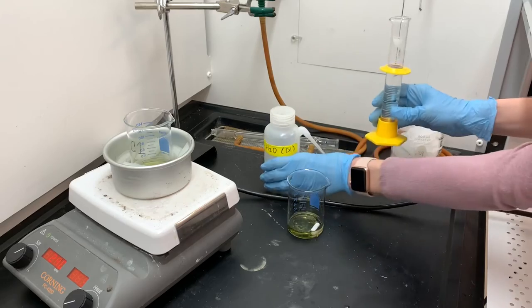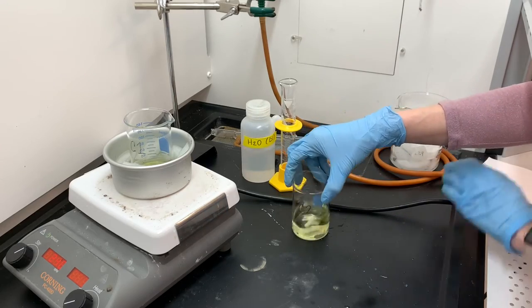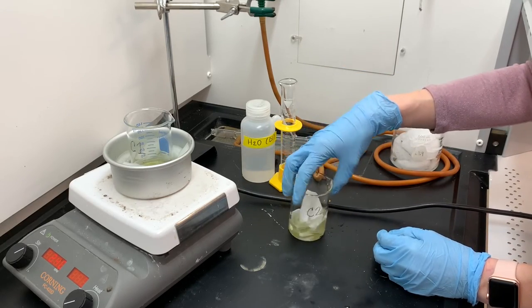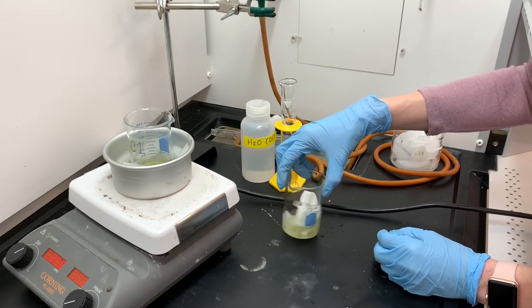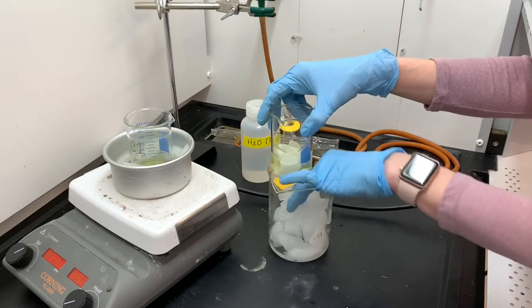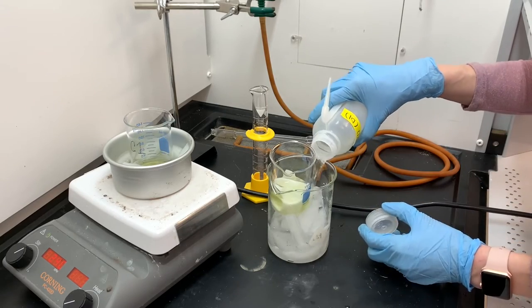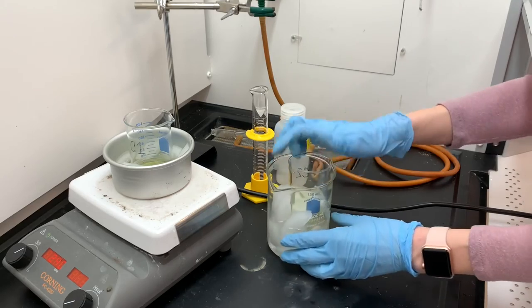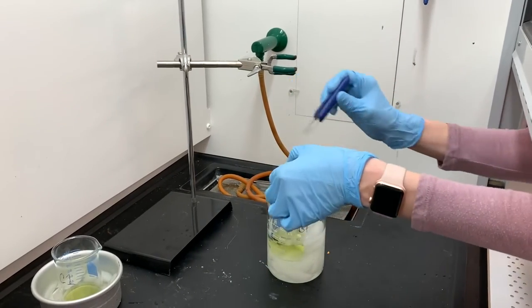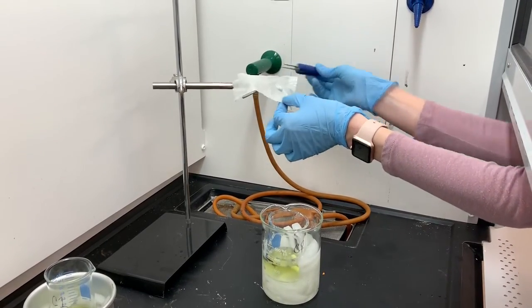I'm going to add 40 mL of chilled water to the C2 solution to dilute it further, then I'm going to add the cloth into this C2 solution and let it soak. I want to get it really saturated. I'll put it on ice and let it sit in the ice water bath for a while to get really good saturation in the cloth. After about five minutes of soaking, I'll pull it out. Notice the cloth is still white even though the solution is green. I'm going to hang it up and let it dry completely while I work on the direct synthesis of the azo dye.